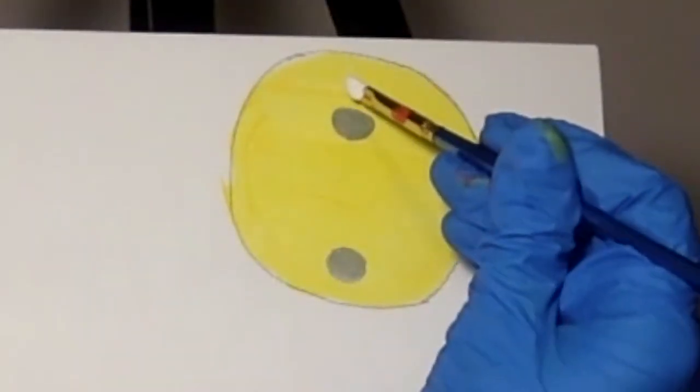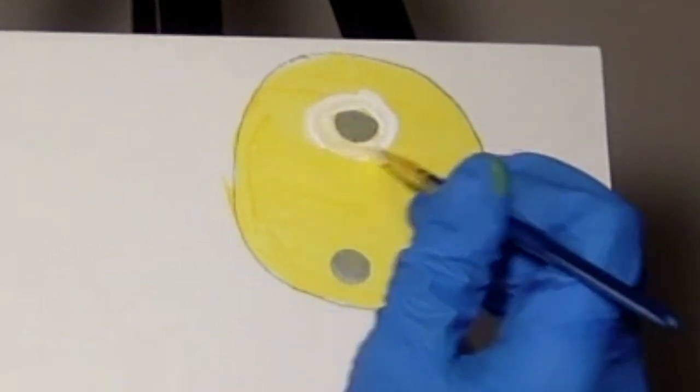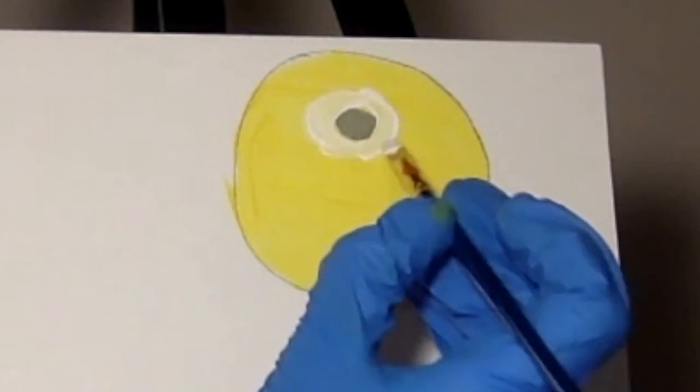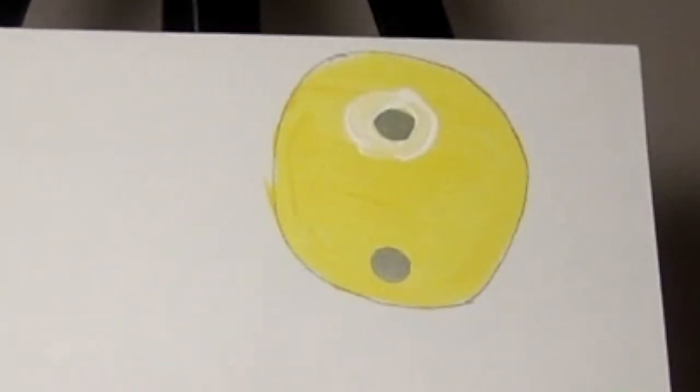This diffusion method can also be used in a culture of S. aureus to determine if it is methicillin resistant. A disc soaked in methicillin is placed in a culture of S. aureus, and if a zone of inhibition shows up, then this antibiotic is effective in controlling the growth of Staph aureus. If it doesn't show up, then this strain might be methicillin resistant, like on the bottom, which is why I'm wearing gloves.